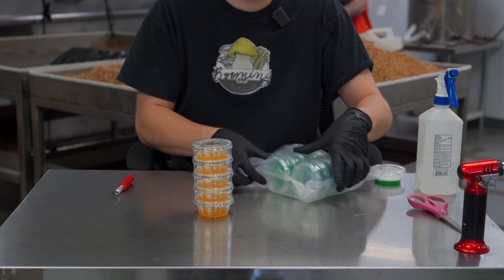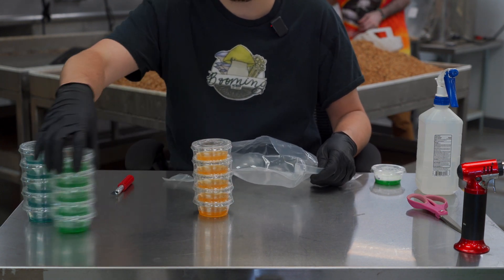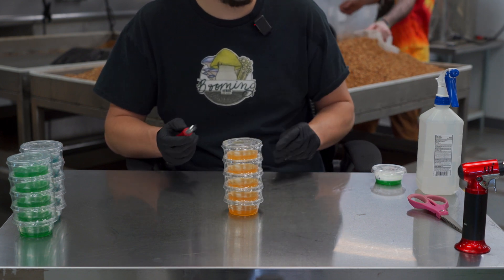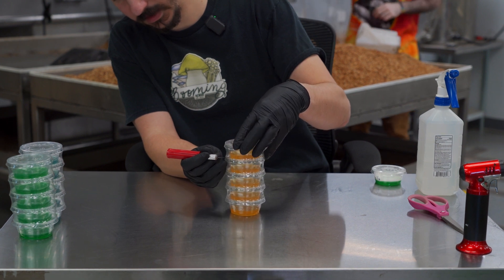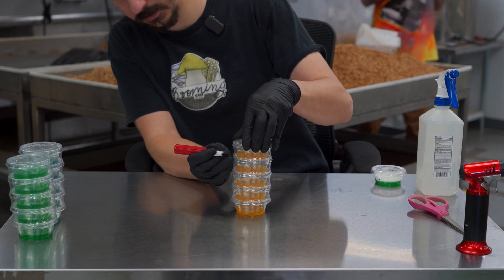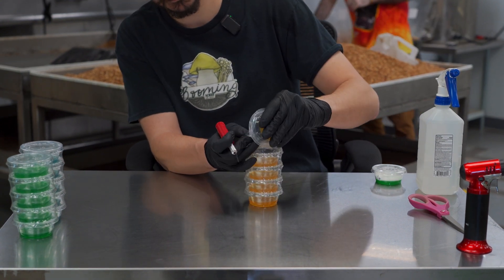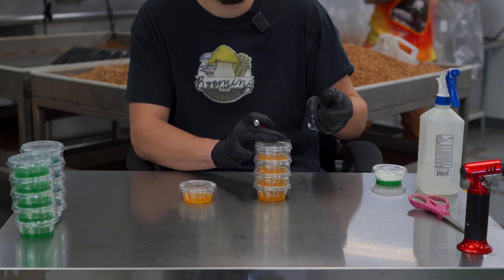Remove a stack of cups — you can remove all of them if you want, we're only going to demonstrate with one. To get your cups out, take a clean exacto knife blade, insert it at the bottom of the cup you plan to use, rotate your cup around cutting through the shrink wrap, and peel away. There we go — that one's good to use.